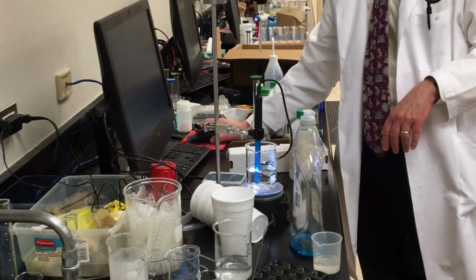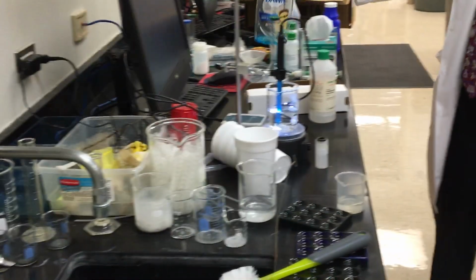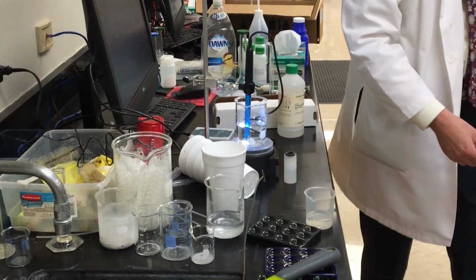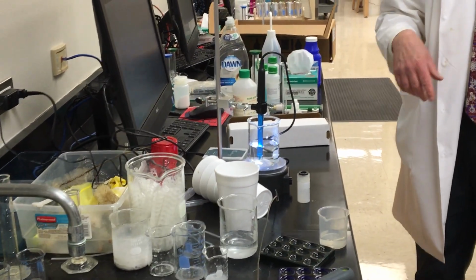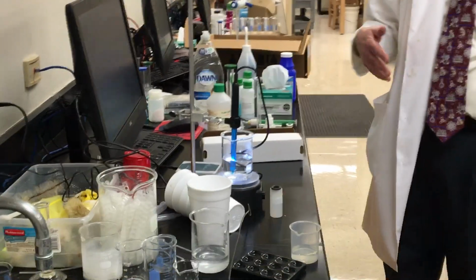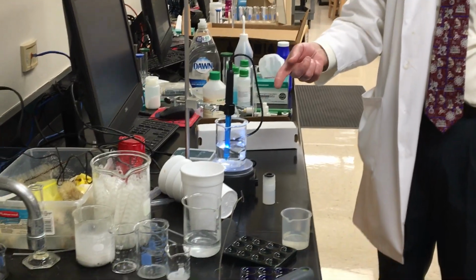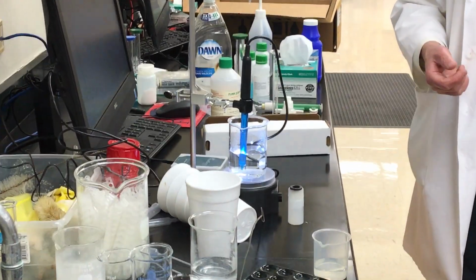Mr. McKnight? Yes. Is it okay if we move the Dawn soap over a little bit? Oh, yes, thank you. And y'all, as long as you stay this distance away, you can get on different sides to see what's going on. All right. Take a look at what we're doing. I am measuring the pH of this stuff, and I'm getting a pH of this acid of about 1.18.